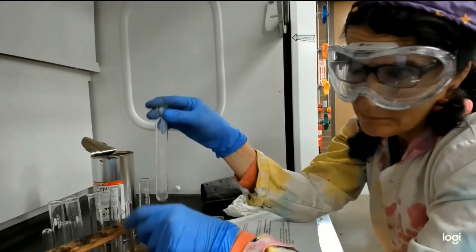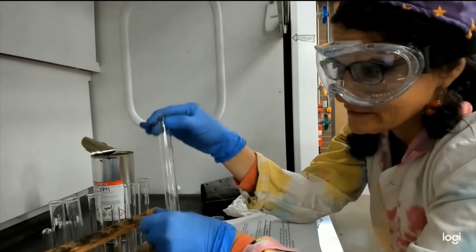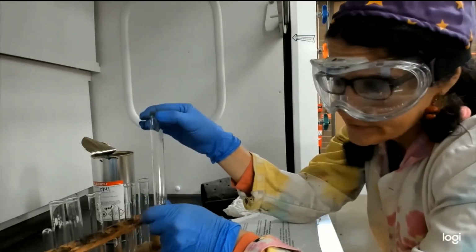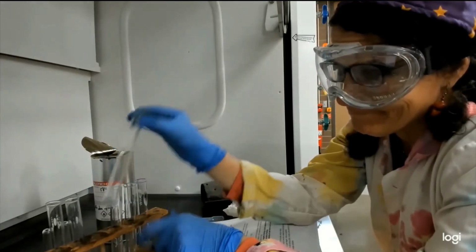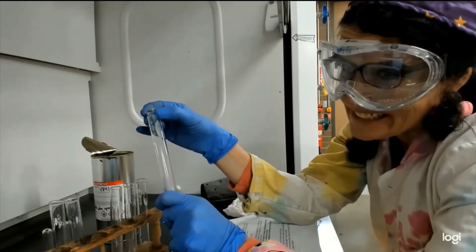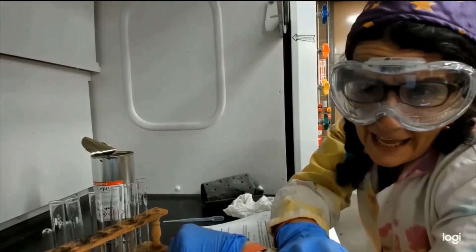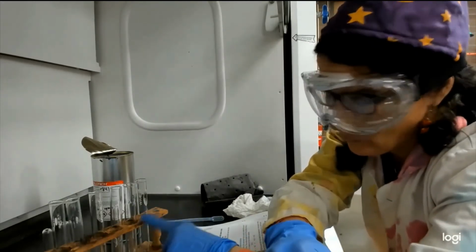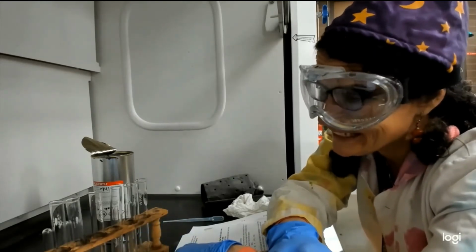It's quite warm. It's like a little warm hand warmer. See our unknowns. See, it feels warm. Oh, J doesn't. Very dry test tubes. So we got alcohol here. One that we know we have. And our unknown C, I think it's an alcohol.